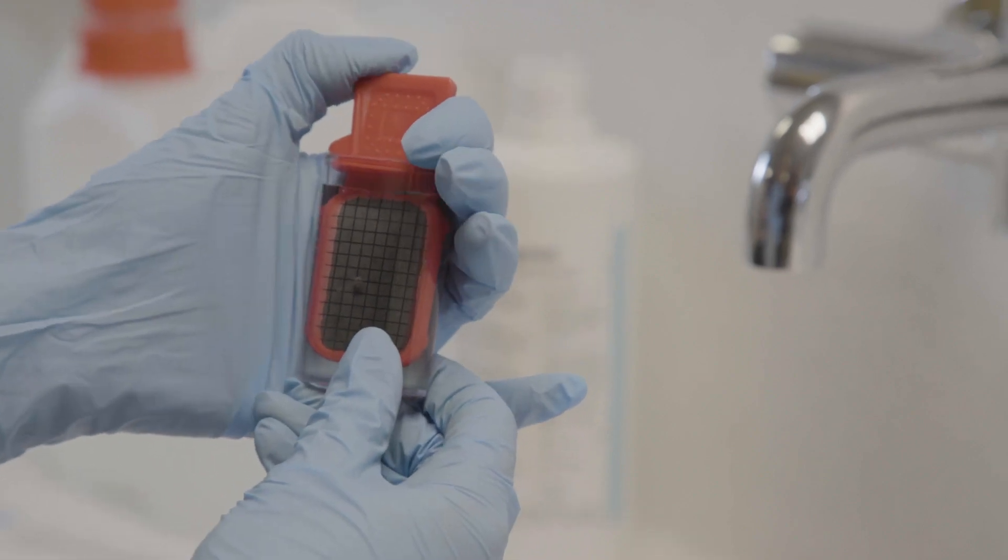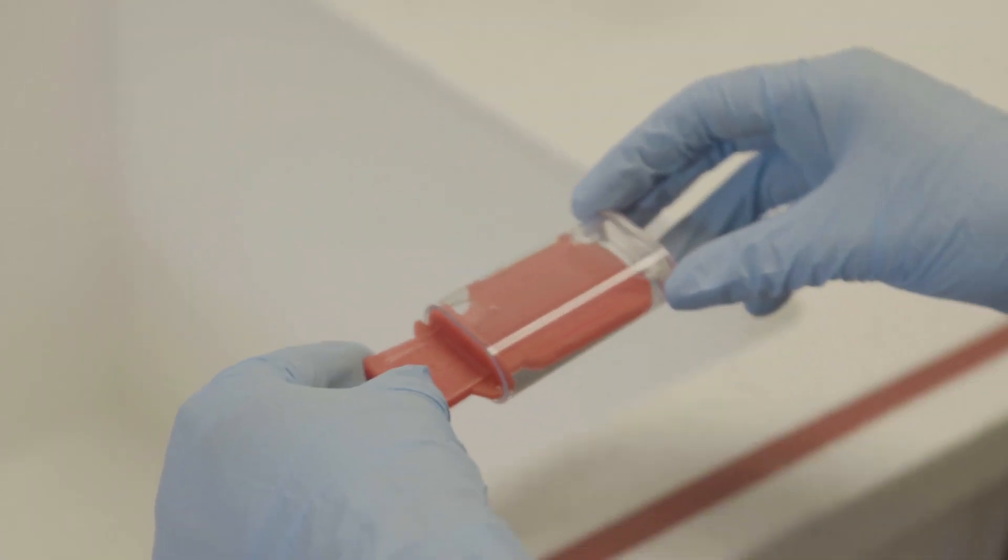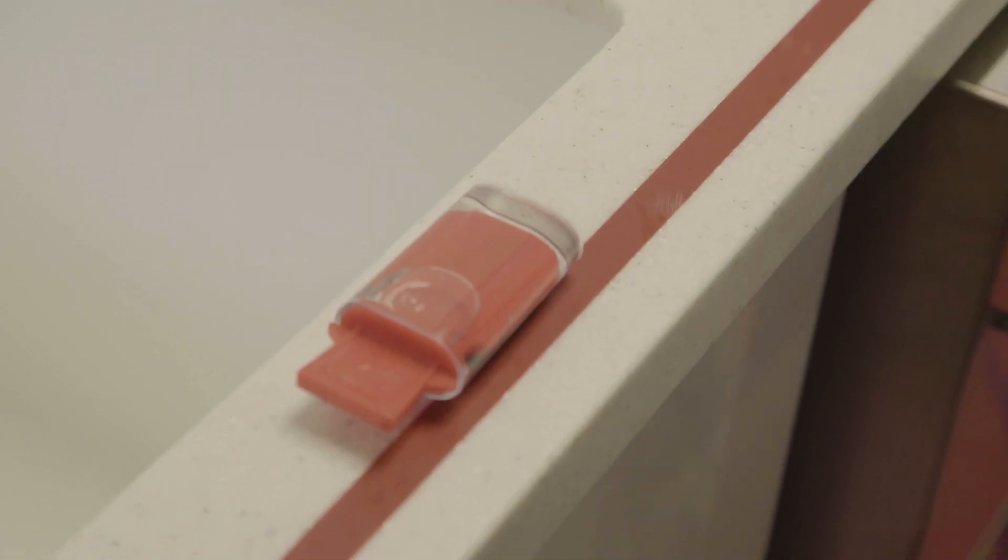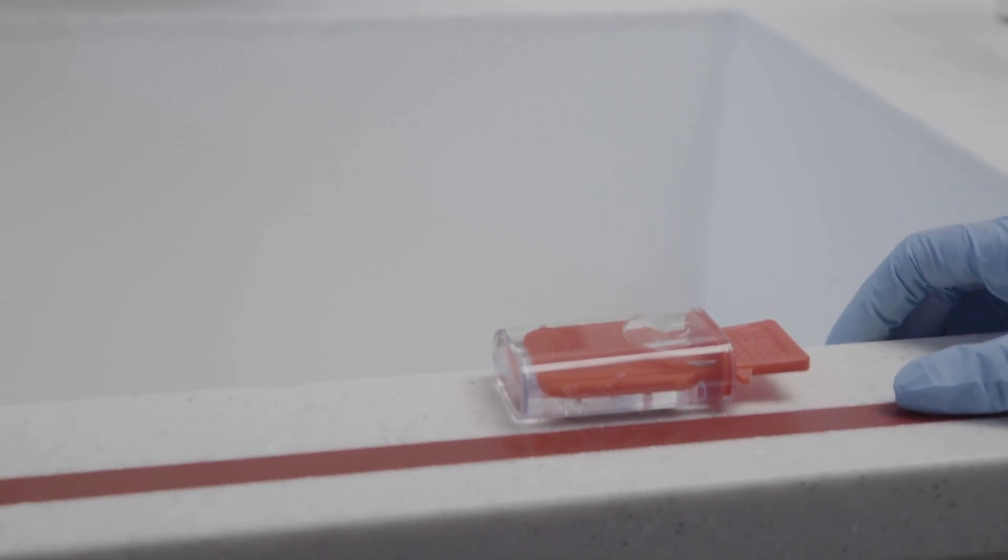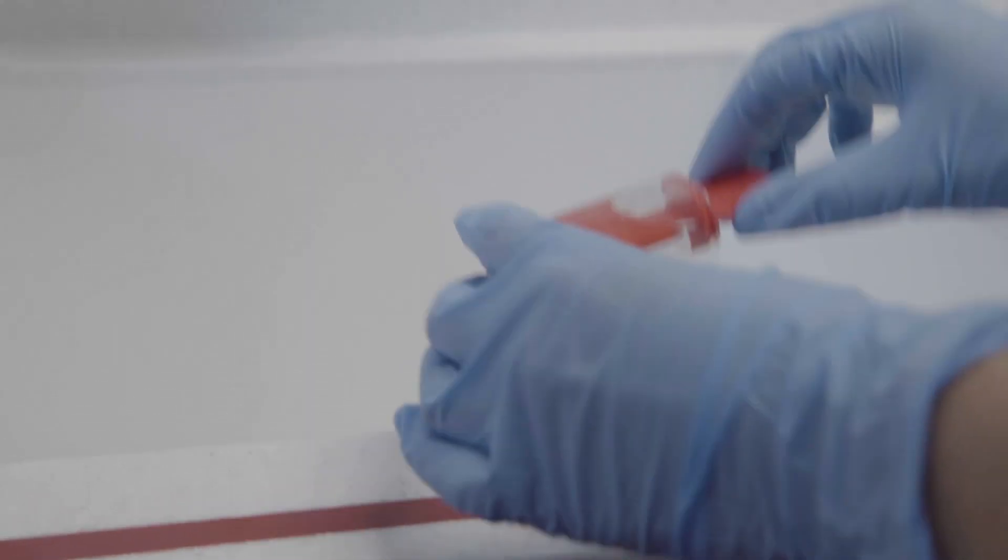Place red side up on a flat surface for 30 seconds. Wait 30 seconds for the water sample to be absorbed into the freeze dried media. You may see an air bubble pop out of a small hole on the red side of the paddle.